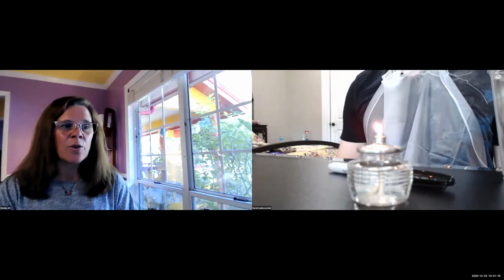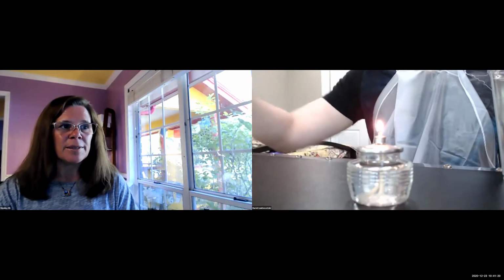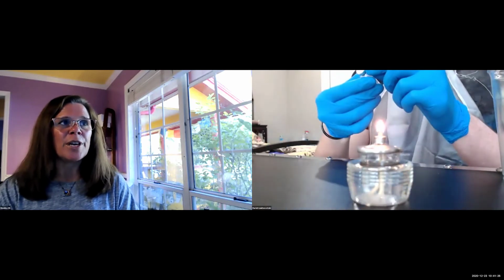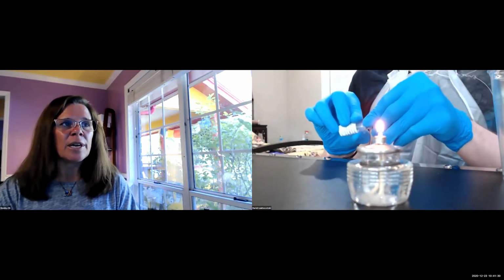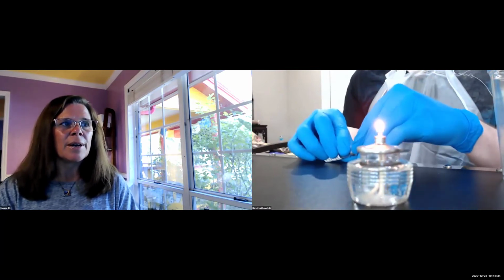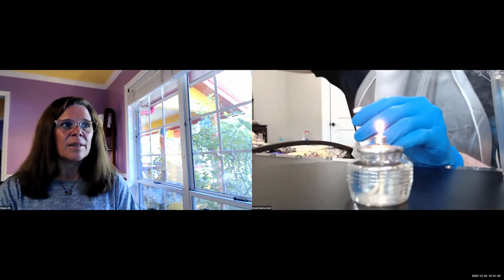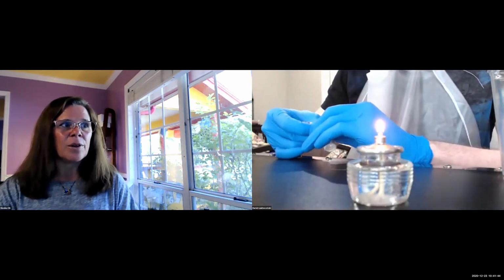So if you take now your dehydrated culture, your Staph epidermidis, you can take off the little metal cap, there's a little perforation. I don't know if you can get in with your fingernails or little tweezers, but you have to pull it off. So I use the little pin I have here, just to pull it up a little bit, to loosen it.